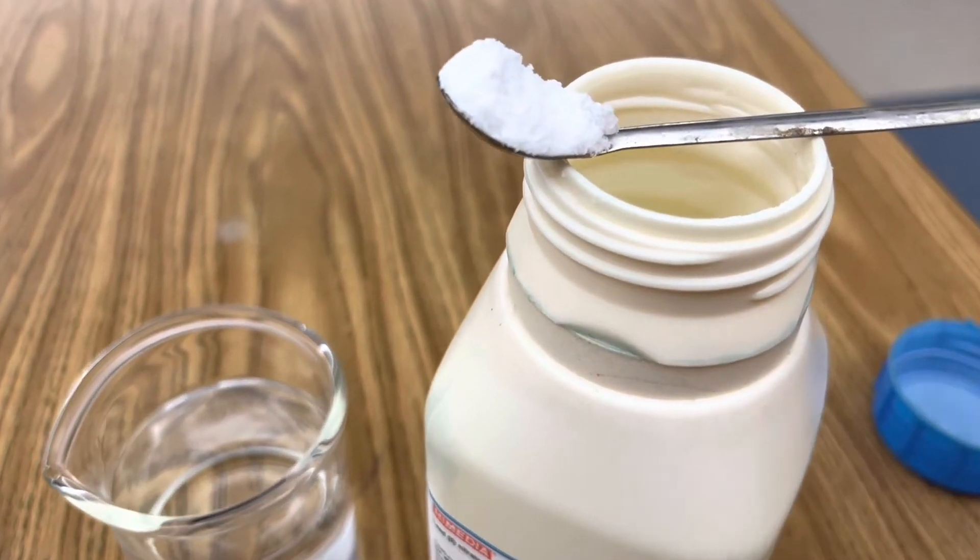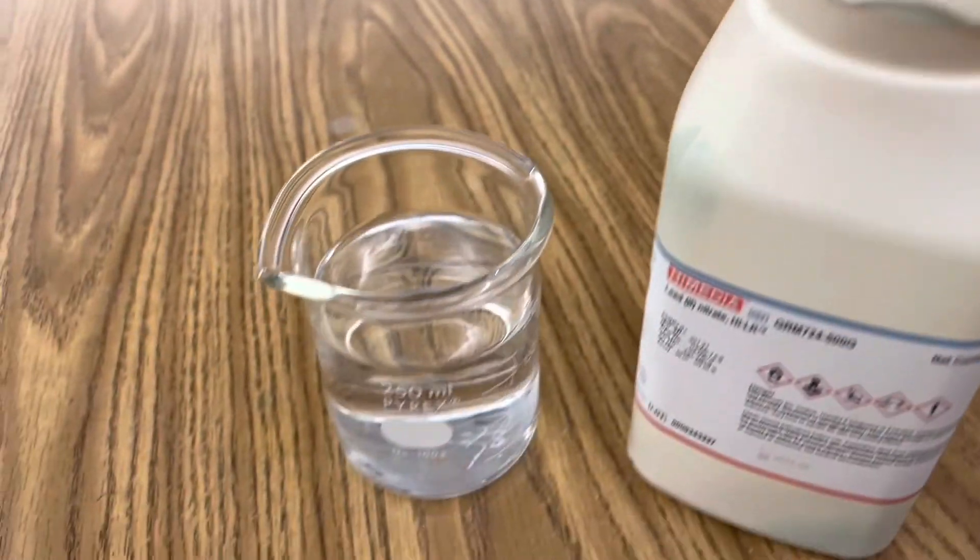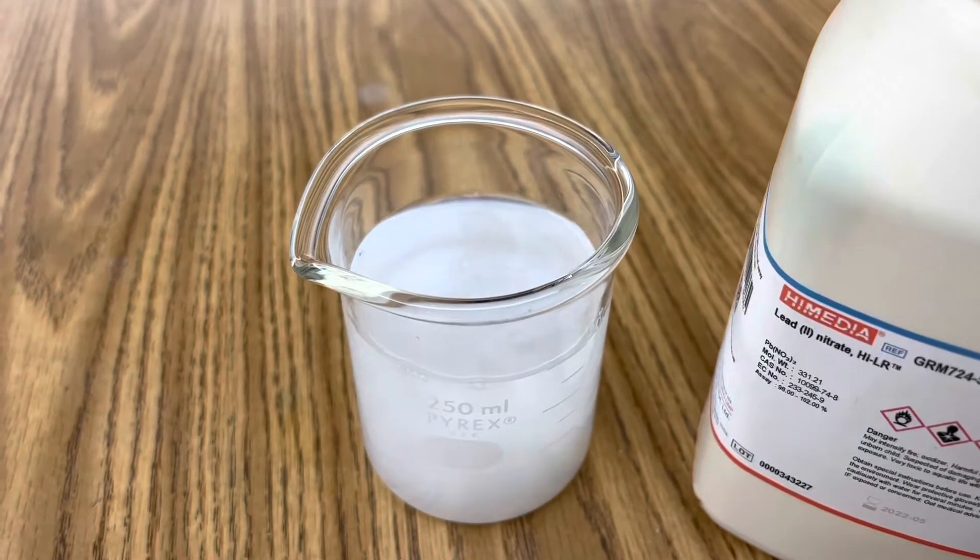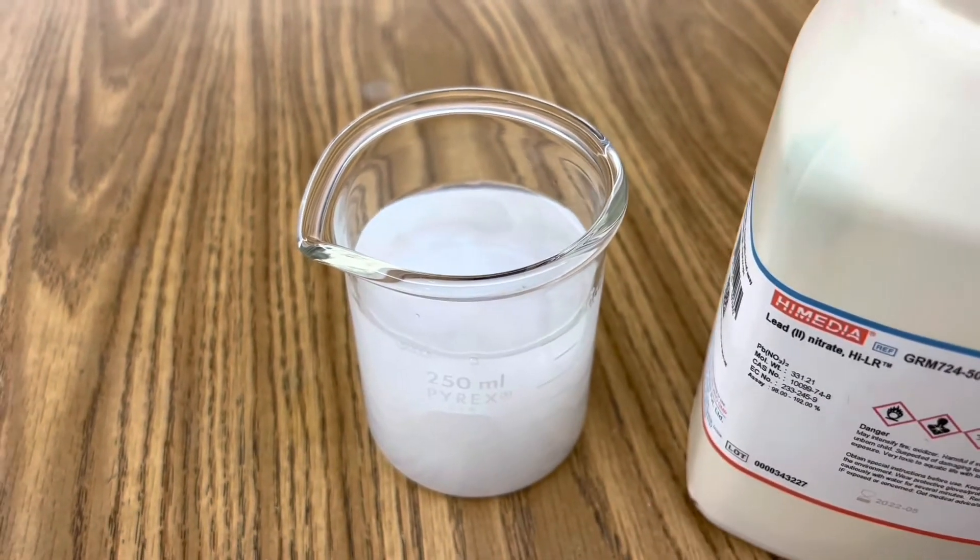To begin, add 10 grams of lead nitrate to your solution and make sure that you mix this until it's completely aqueous.